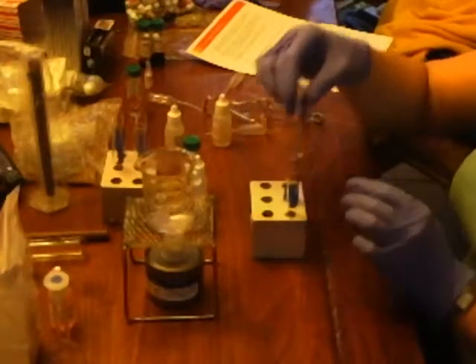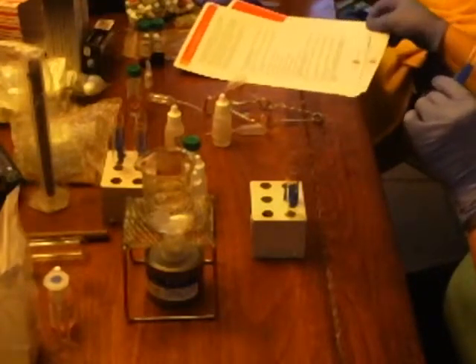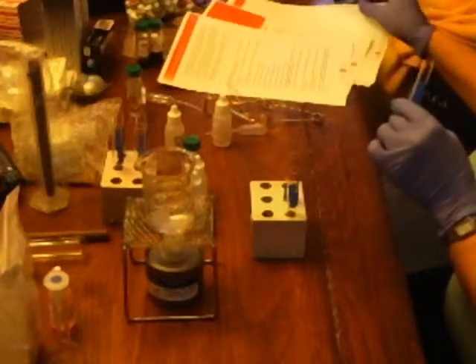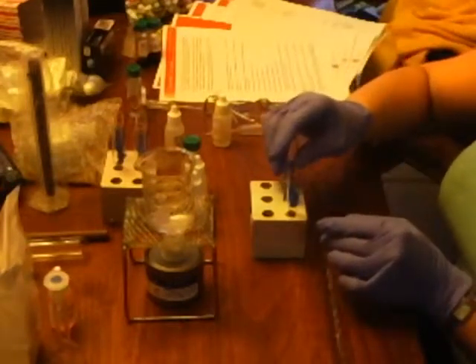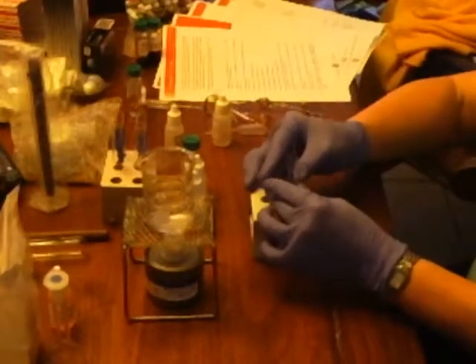That's test tube 2. Test tube 3. Again, it's kind of a fruity, odd smell. Almost like pears or Fuji apple. But definitely a fruit smell. That's it. Yep.